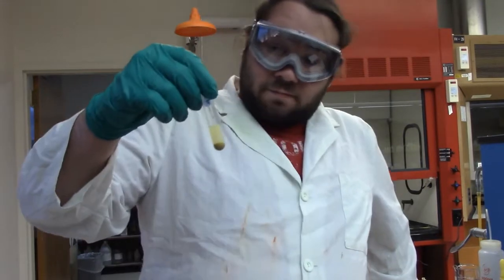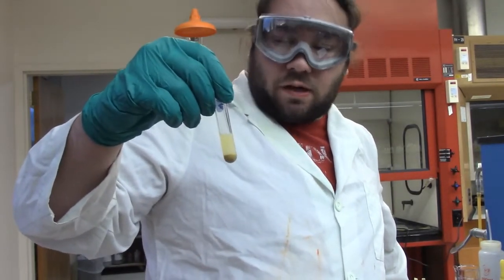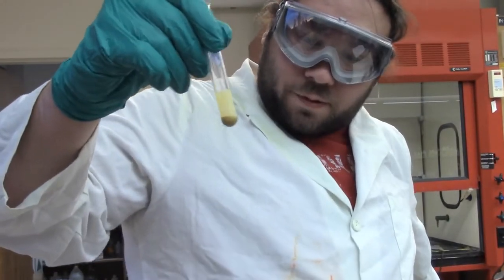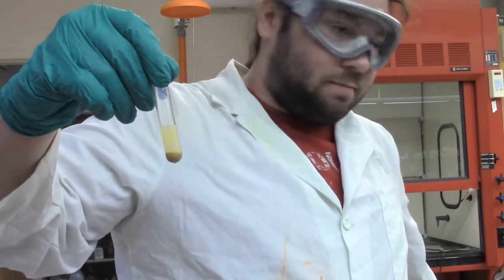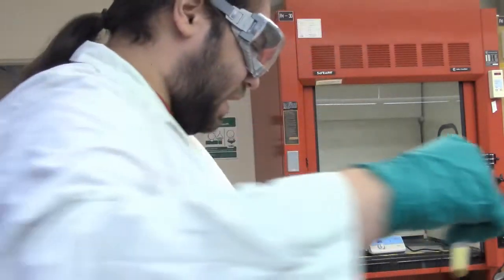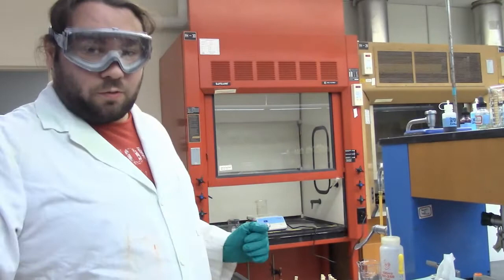Alright, so I've heated it, and if you look at the solution, it's kind of a cloudy, tannish solution, but at the bottom we do have a thick clump of our precipitate down there, so there is a precipitate from this. You guys get to tell me if that means we have tin or not. So I'm going to put that over here, my samples, and at the end, like we do with the other videos, we'll go through all of them.